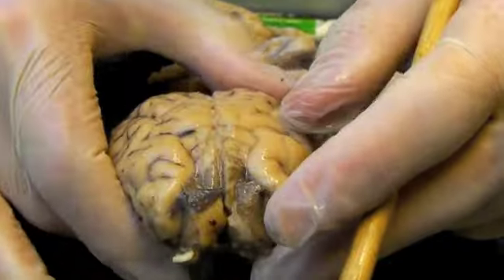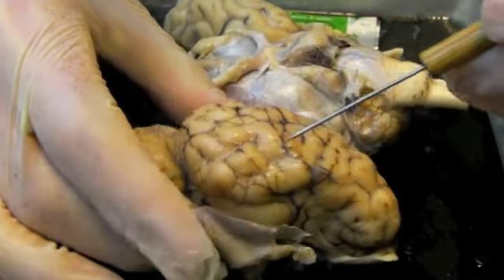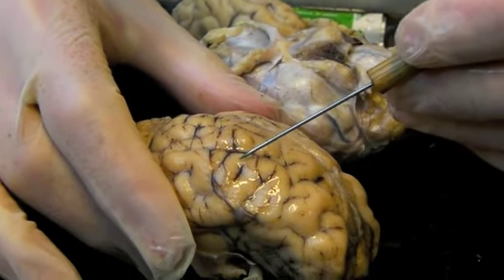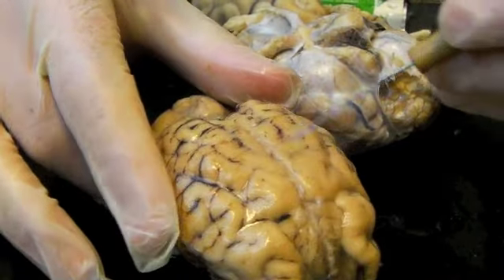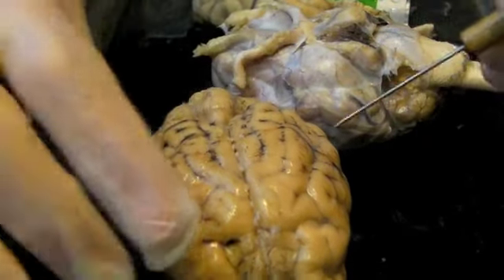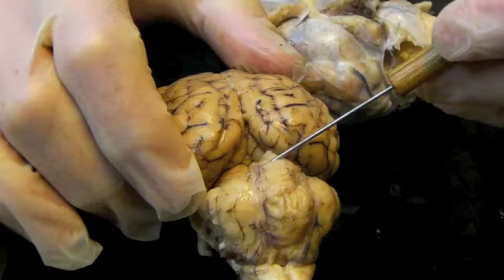Now, just looking at the cerebral hemispheres on both sides, they're generally areas of the frontal lobe, parietal lobe, temporal lobe, and occipital lobe. And there are convolutions with elevations called gyri, and then depressions called sulci, all throughout the hemisphere. This is the cerebral gray matter. Also seen on this view, behind the cerebral hemispheres, is the cerebellum, the structure here.